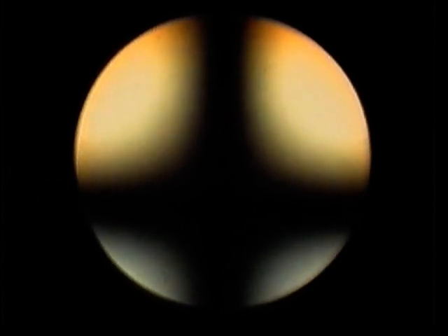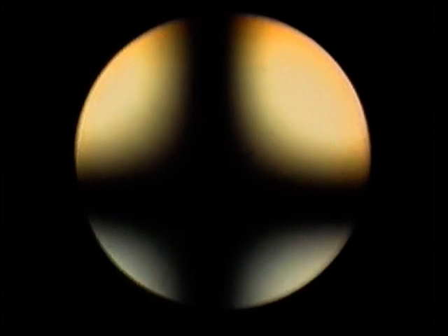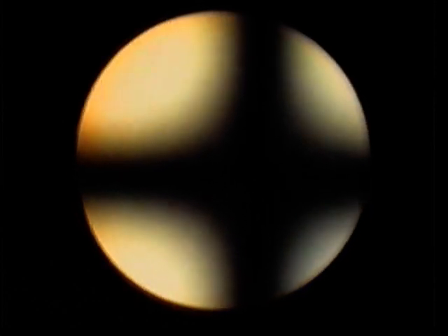Here's a centred optic axis figure, and I'm tilting the crystal slightly so the optic axis moves from the vertical. Rotating the stage causes the centre of the isogyre cross to rotate in the same direction. The isogyres do not rotate.